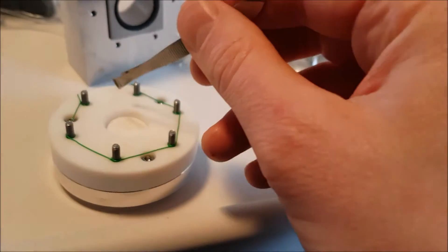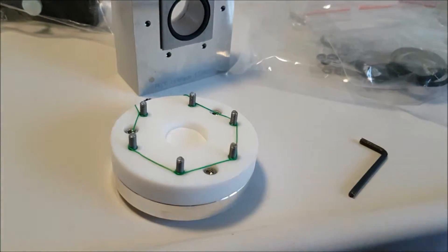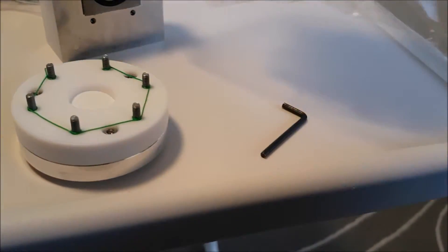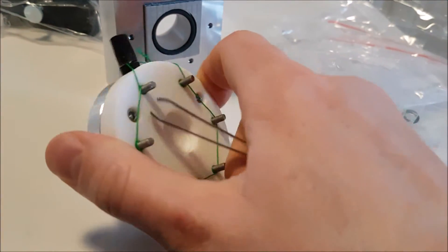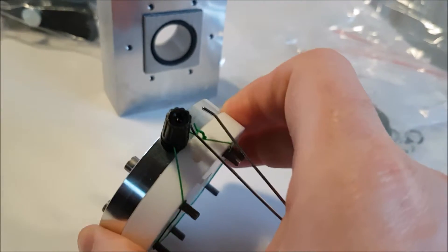We could even put a little 25mm o-ring around the edge. There's no problem, plenty of o-rings. And effectively you would put a current collector down the back.